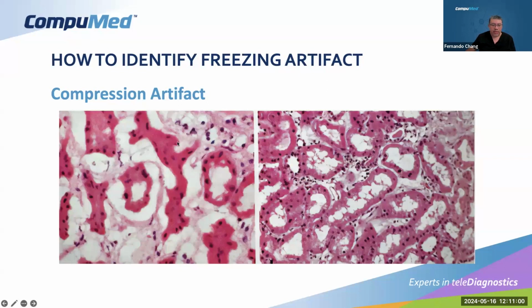And in this case, you see the compression of everything around, the interstitium and the tubuli. So this tubuli was compressed to the center and basically imploded in the center, leaving this space around. And this is one of the most frequent types of freezing artifact that we have, called compression artifact.